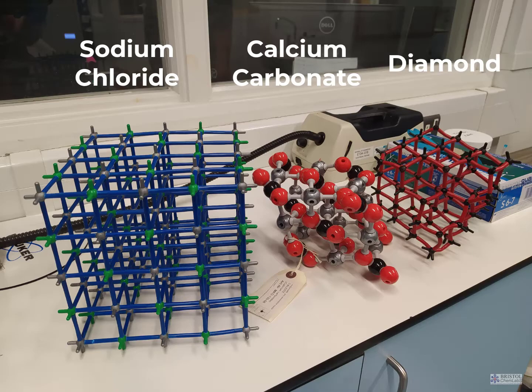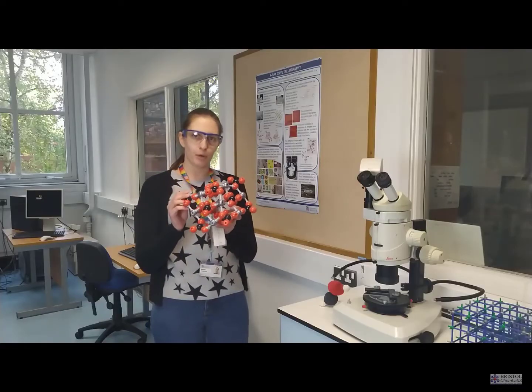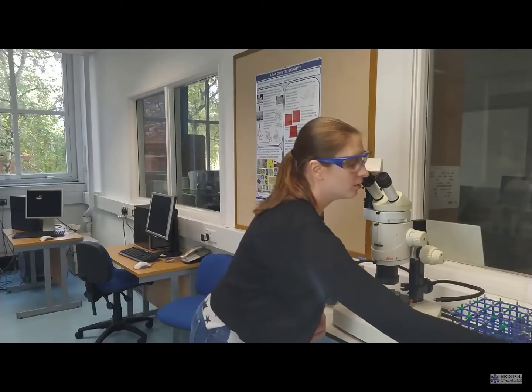However, I can't look at just one molecule on its own because I won't get a strong enough signal. So to amplify the signal, we need to form what's known as a crystal structure. So you may have seen the sodium chloride lattice before. This is a 3D ordered array of our atoms, and while you get this for quite simple structures, calcium carbonate getting a bit more complex, we can also get a crystal structure for more complicated molecules.